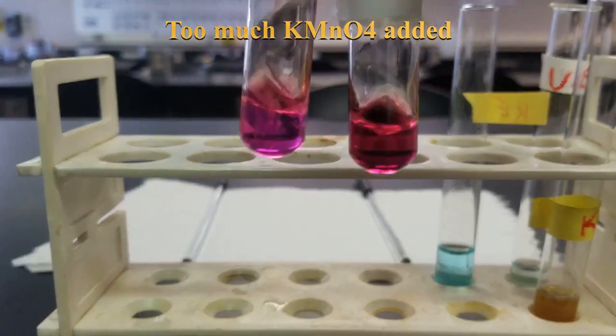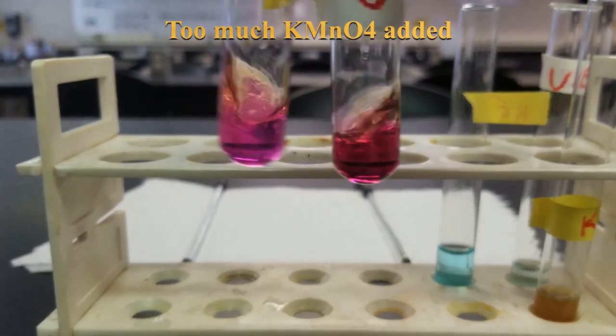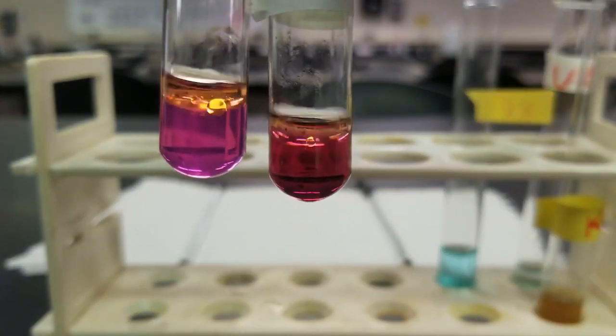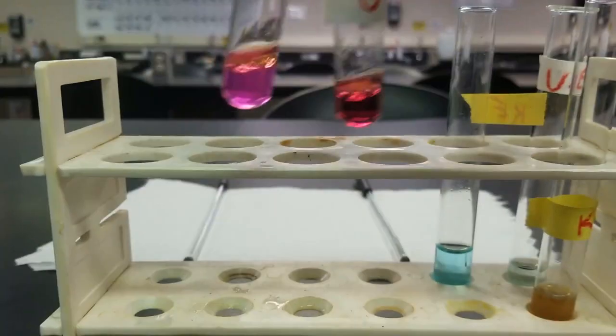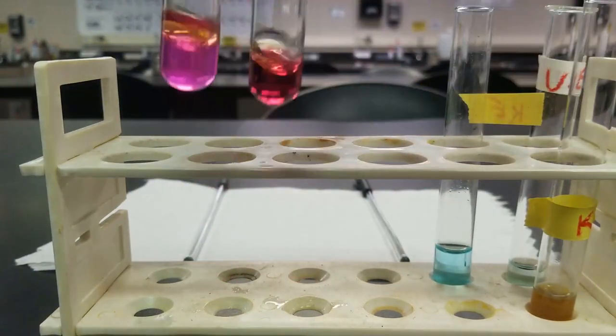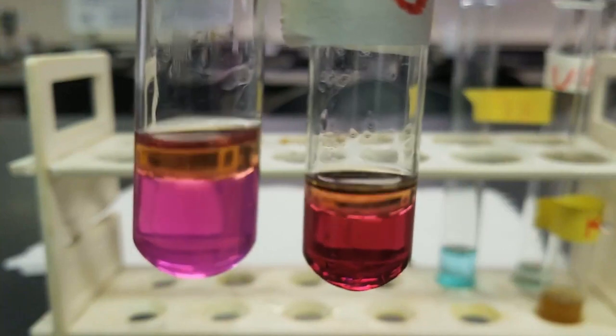So you can see we've got 2 pink aqueous layers right now. And you can see both of the tops of our solutions are nice and brown, indicating the presence of the bromine. Not too shabby.